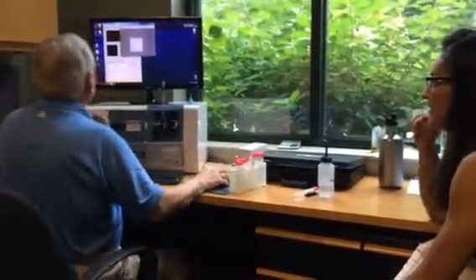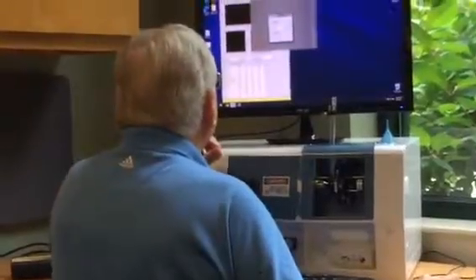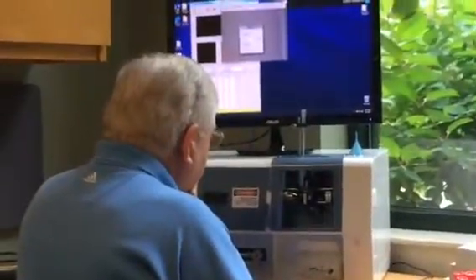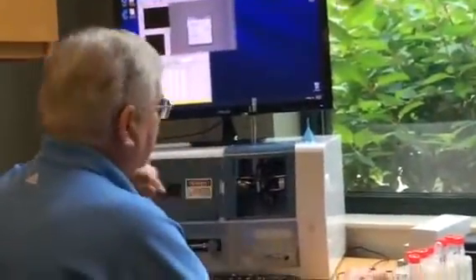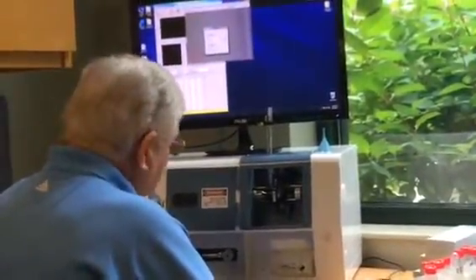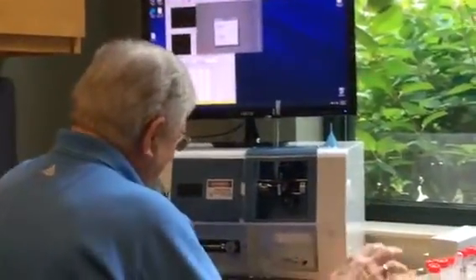That's it. And this thing, we're just going to start pumping, get this thing down, and it's going to be fine. Start the pump and get it to run. You can go ahead and hover your mouse right over this X, so that as soon as you see the sample is drawn, you're ready to cancel it. But I don't see it. Remember before we would see it, but we don't see it. All I'm doing is waiting for this thing to get down here, and then shut it down. Exactly. And I'm not going to sit on the table again when you start actually running your sample. I won't touch the table, habit though it may be.